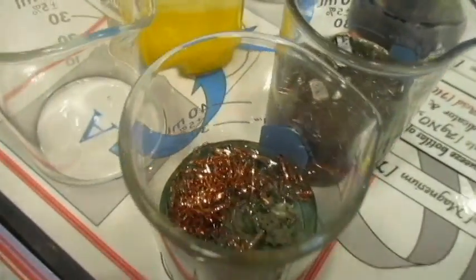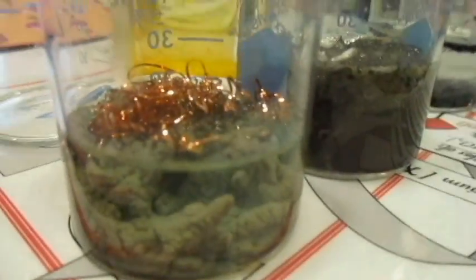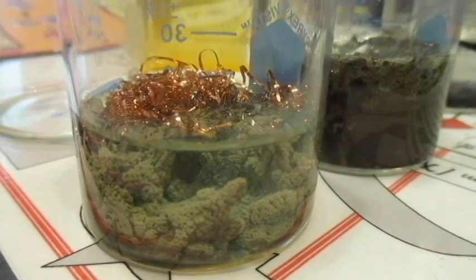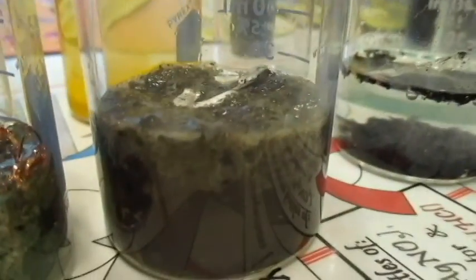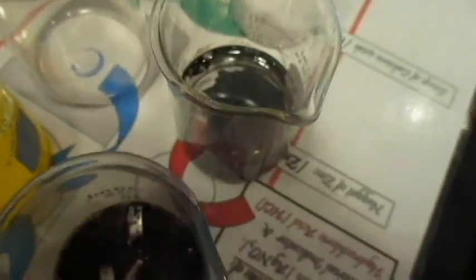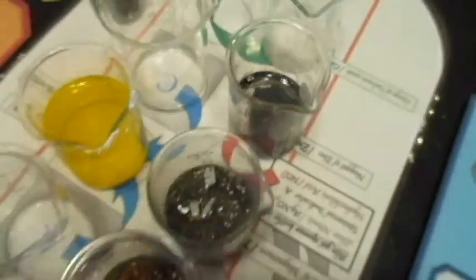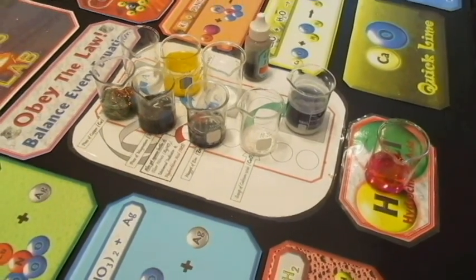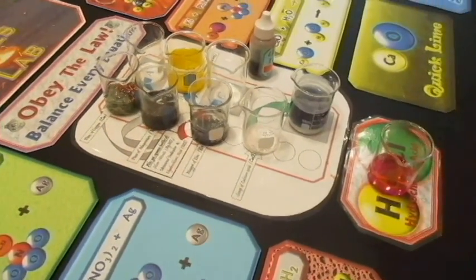And this one is also interesting looking. Look at all that silver. We could be rich if it wasn't so gross. Look at all that silver again. Okay, so these reactions have completed now. And this reaction also, I believe, I don't see any unreacted material. So that kind of sums it up for the indoor reactions for the reaction types lab.